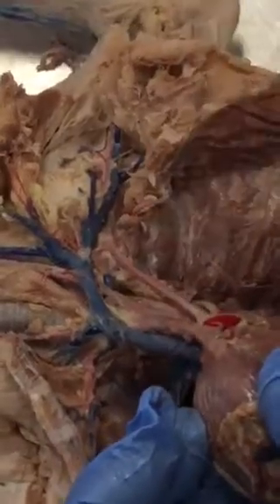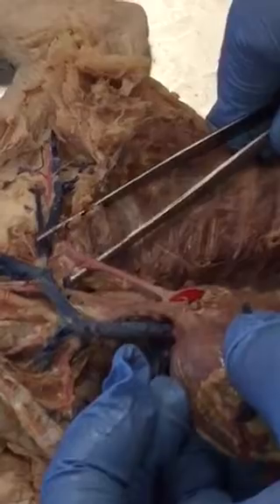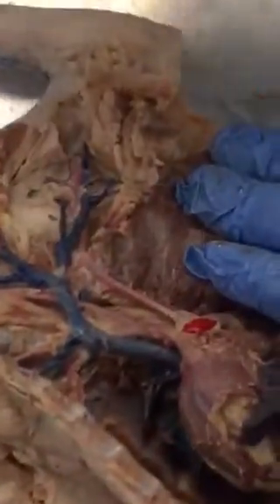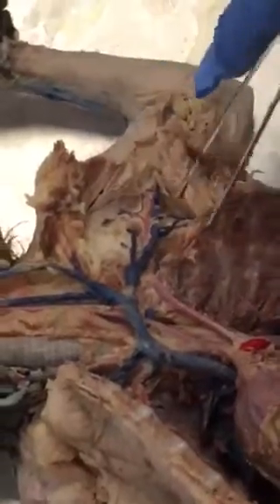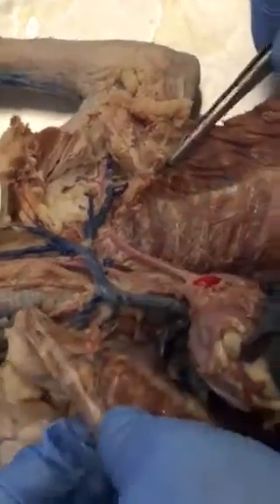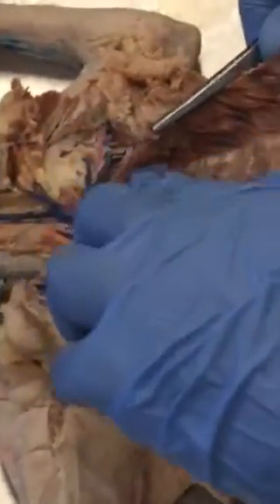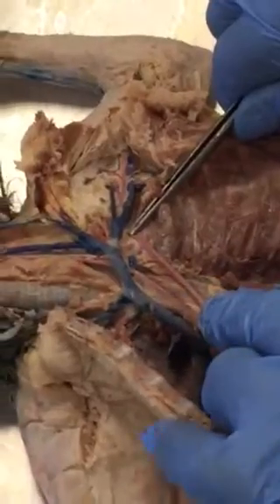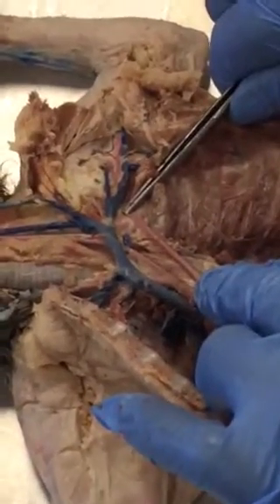This one is the left, this is my right, so this is the left. This is the left subclavian, and it's left subclavian only until it reaches the internal mammary. Here's the internal mammary. It will meet up with this blue one. Remember the blue one that got busted? So here's the red one that goes with it. So up to this point, between there and there, is your left subclavian.